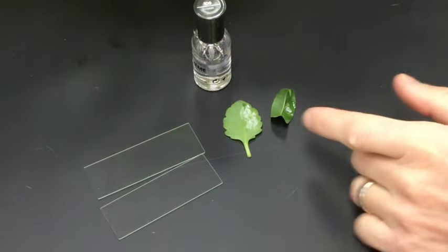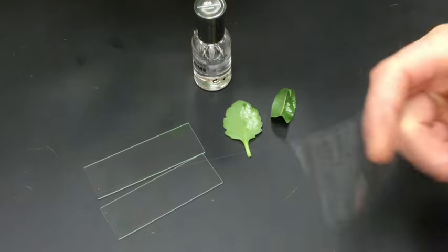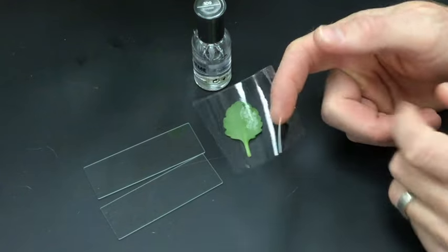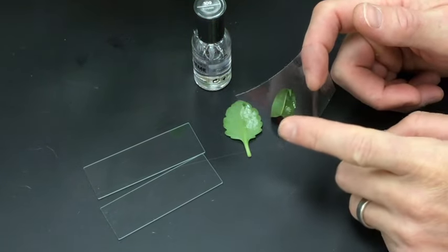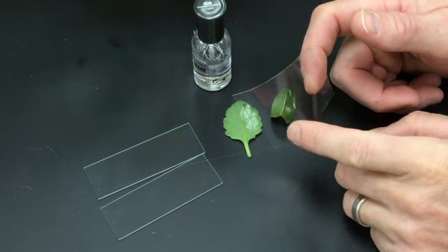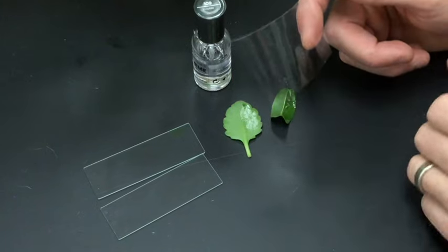Okay, so it's been five minutes. The nail polish is definitely dry. I've got a few pieces of clear tape. I'm just being very careful not to get fingerprints on the parts that I'm going to press onto the leaf. So I've got the middle part of the tape I haven't touched. Just be very aware of that. Fingerprints are going to be your enemy here.